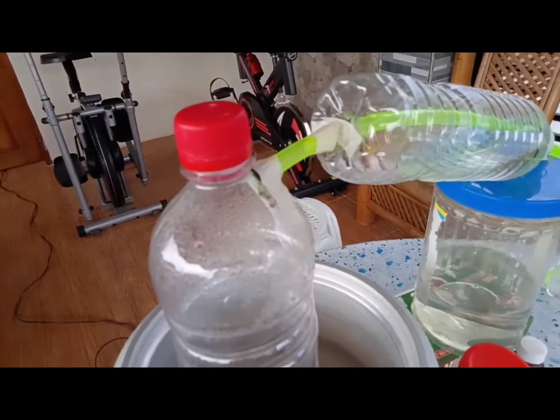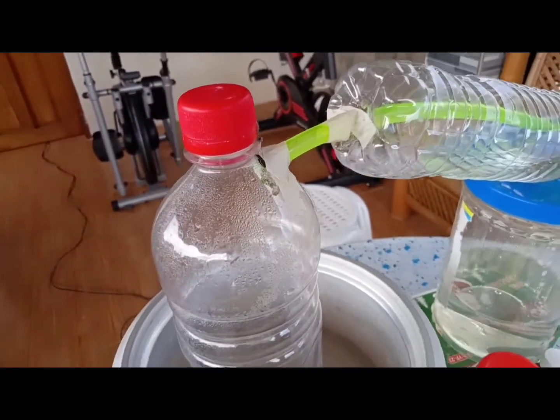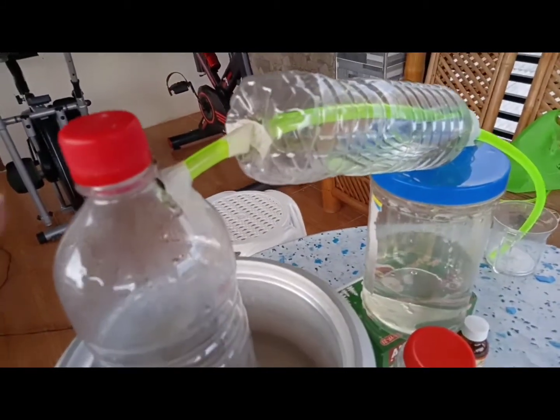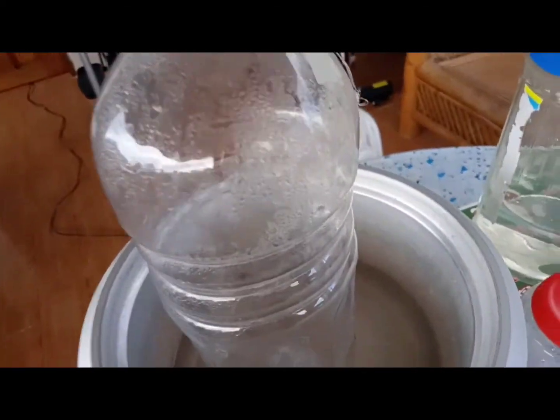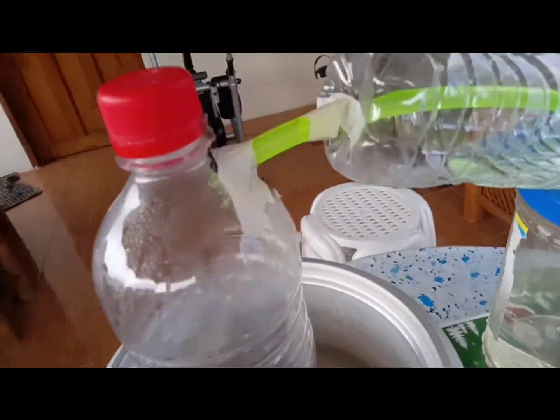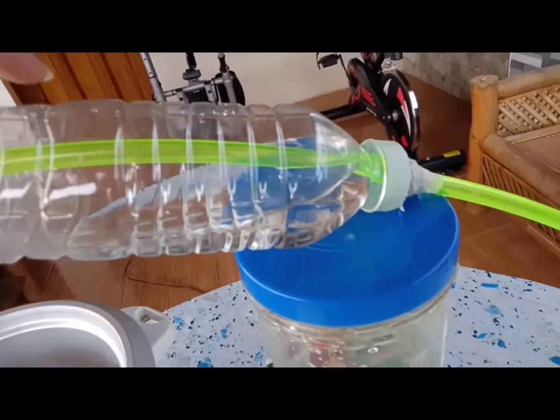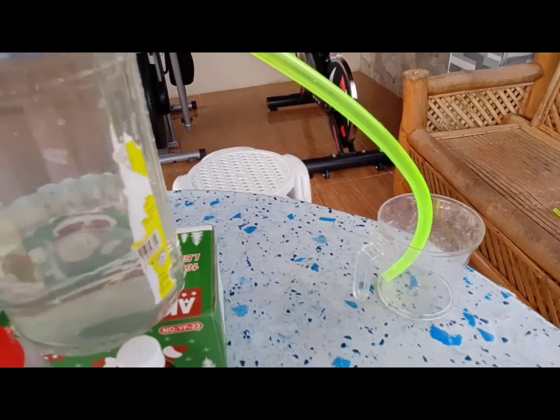So in the meantime, I will give you a short explanation about this distillation process and how this happens. This process begins with heating the liquid inside this container until the boiling point. As it continues to boil, the acetone inside this container will evaporate and form a vapor that goes through this tube or pipe at a lower temperature, down to the beaker or the container.